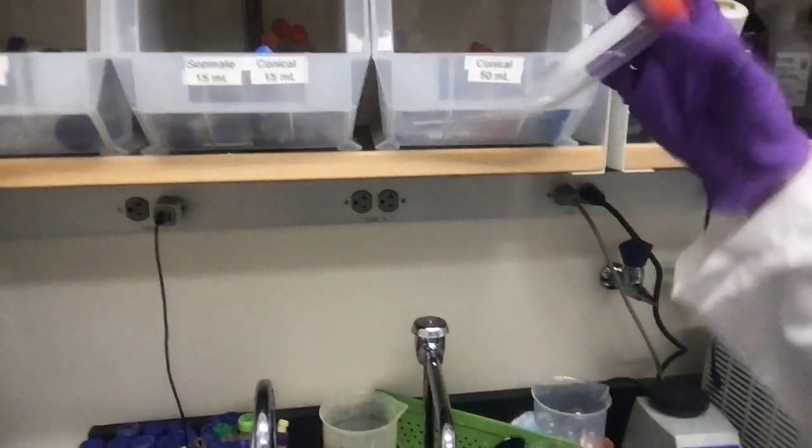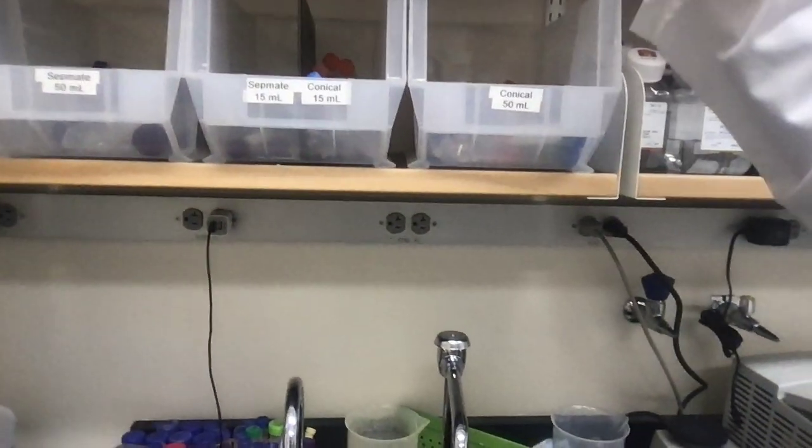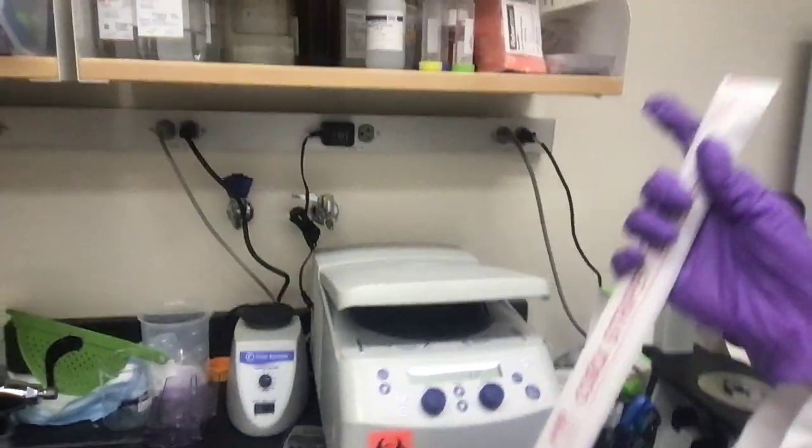More interesting stuff. We have a bunch of conical tubes. Very standard stuff you see in a lab. You have a pipette here. Actually, one important thing about working with these biosafety cabinets is you want to spray everything that you put in it with ethanol before you put it inside. So let me just open up this hood. And there's a line that very precisely tells you how high you can lift up the glass.